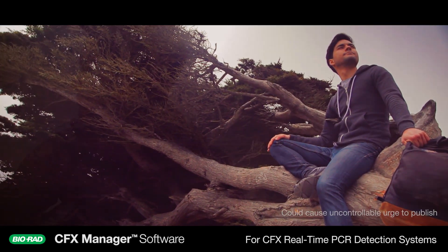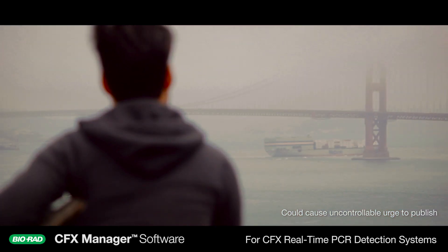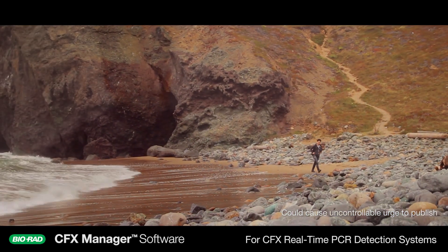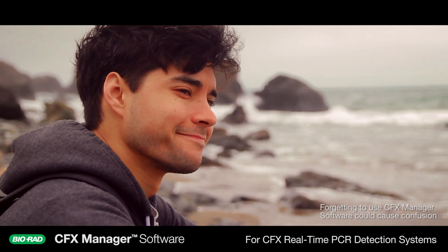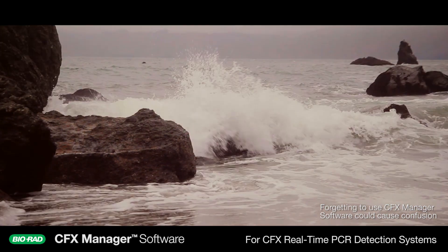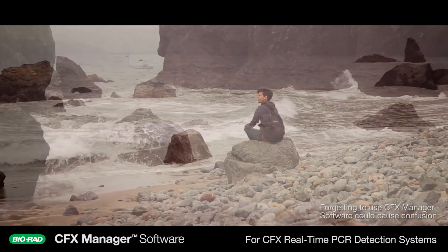Consult your PI if you notice an uncontrollable urge to publish increasing quantities of high-quality research, as this may become permanent. Forgetting to use CFX Manager when performing a qPCR experiment may cause aggression, agitation, hallucination, or confusion.